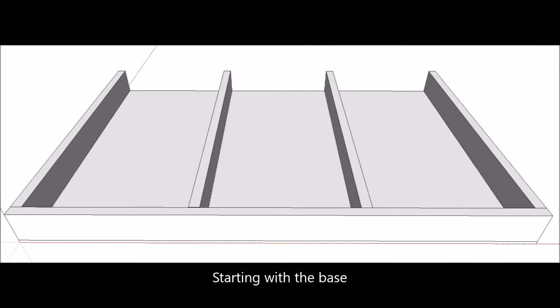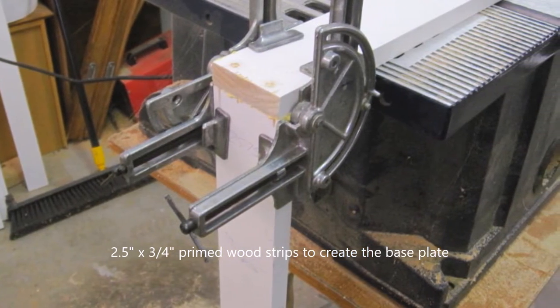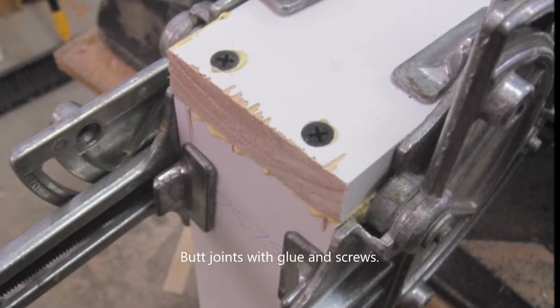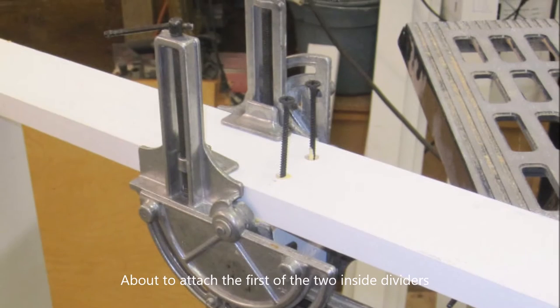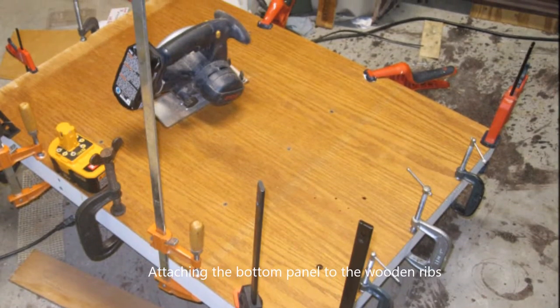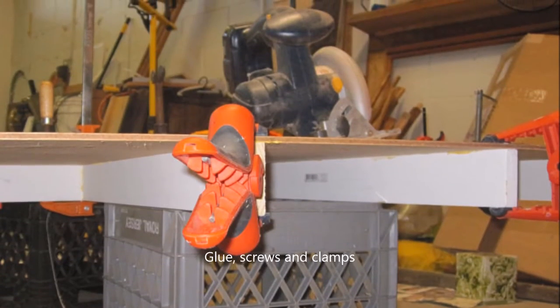The construction plan was pretty simple — a cabinet with front and back. I started with the bottom. The base is essentially wooden strips using a standard butt joint with glue. I pre-drilled the holes and screwed in standard screws to hold the unit. These butt joints worked pretty well — they're quite strong. Once the external frame strips were there, I did the internal strips, then covered the base with a piece of quarter-inch plywood I had scrapped.